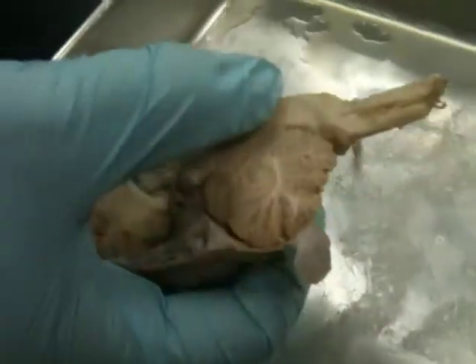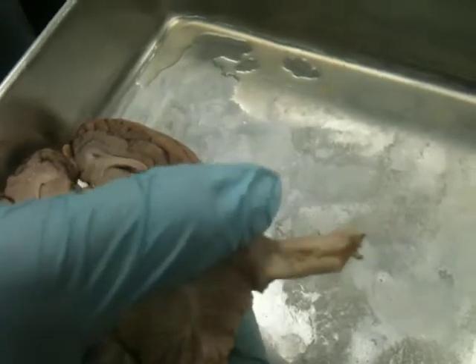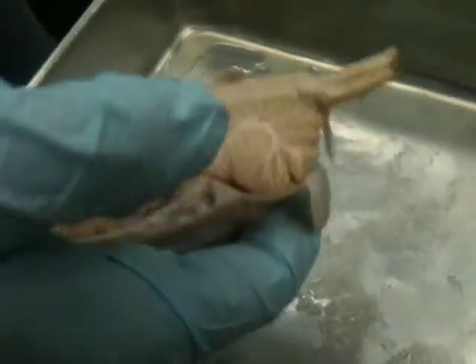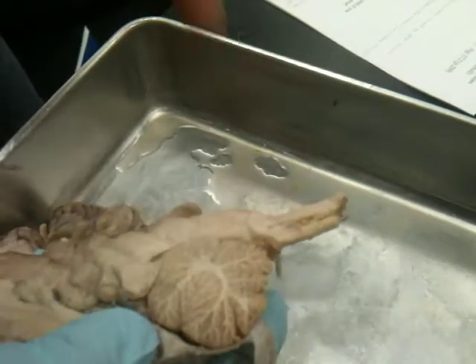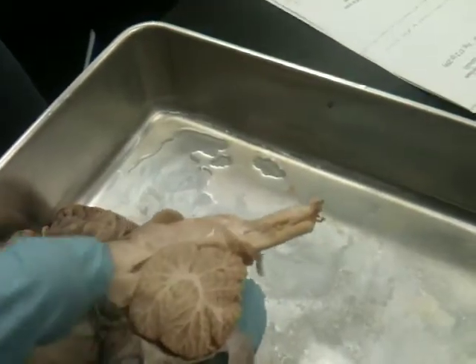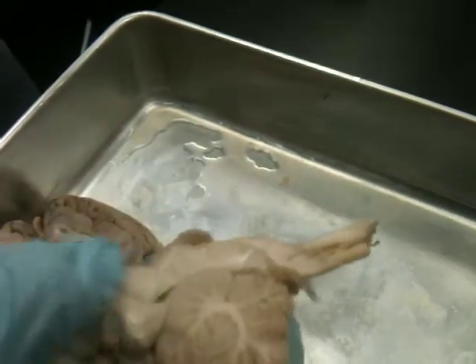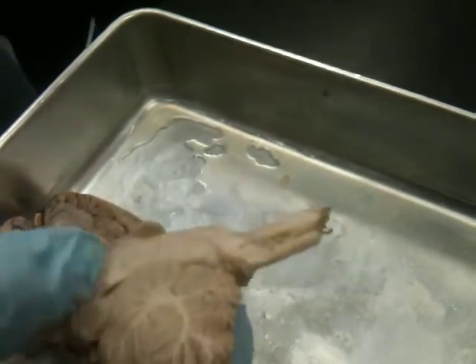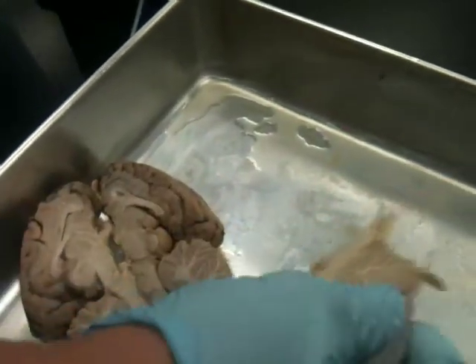That's the pons. And then right here, right before it thins out, is the medulla oblongata. So they're just like regions. So the first part is the pons, and then the part right before it thins out. Why wouldn't that be the pons? What is that? Is that not? No, that's just part of the hypothalamus, because it's still sort of that area below it. It's this first part of the brainstem.